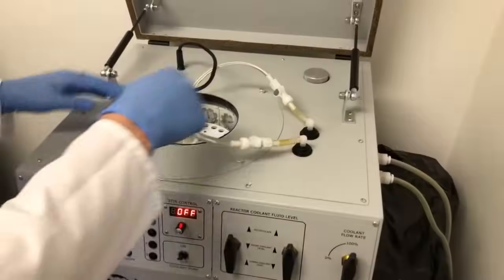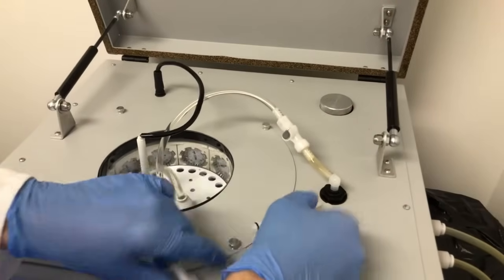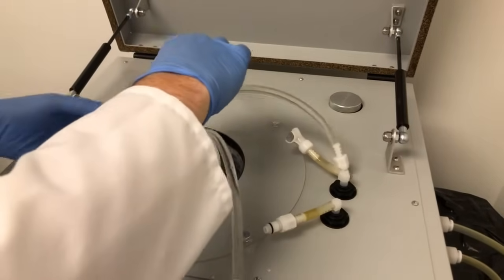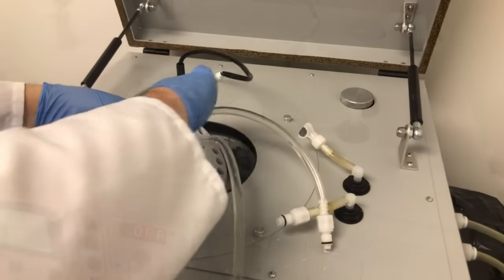Once your reaction is finished, simply disconnect the thermostatic fluid connections, remove the temperature probe from the reaction vessel, and then you can remove the vessel itself.